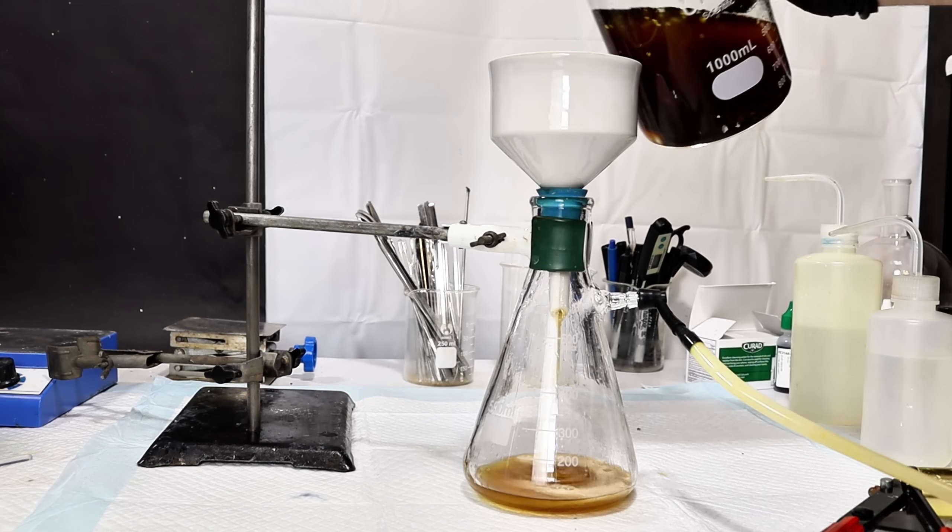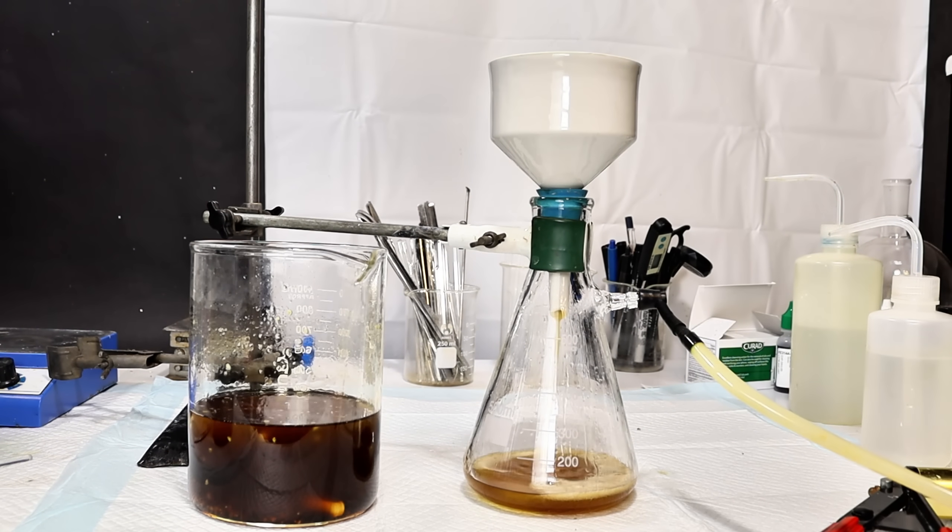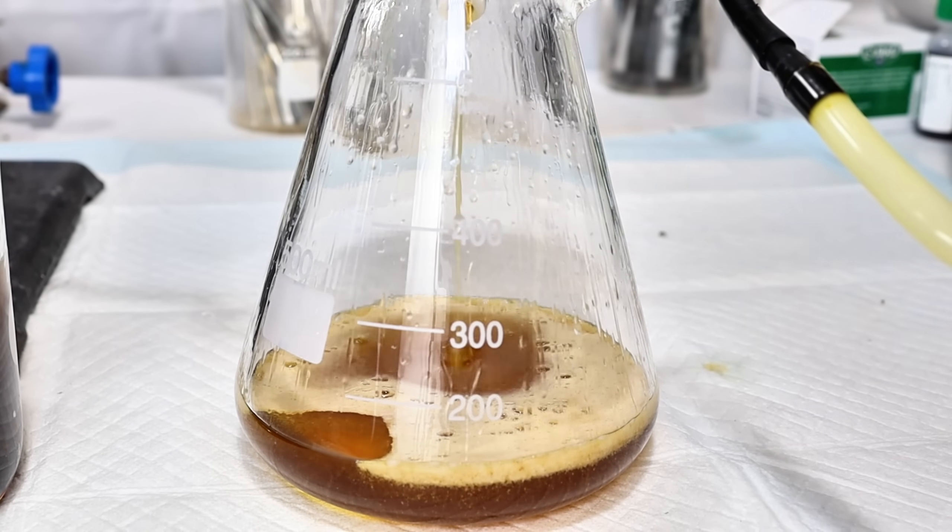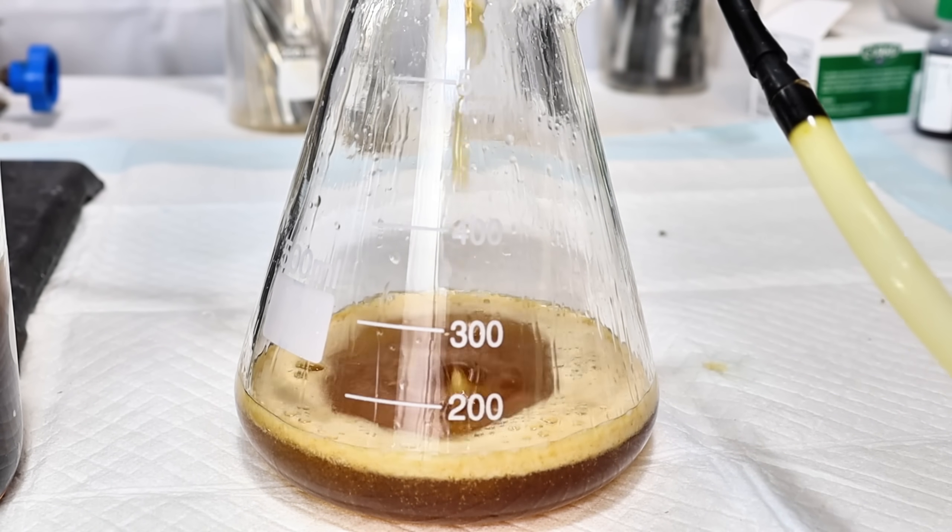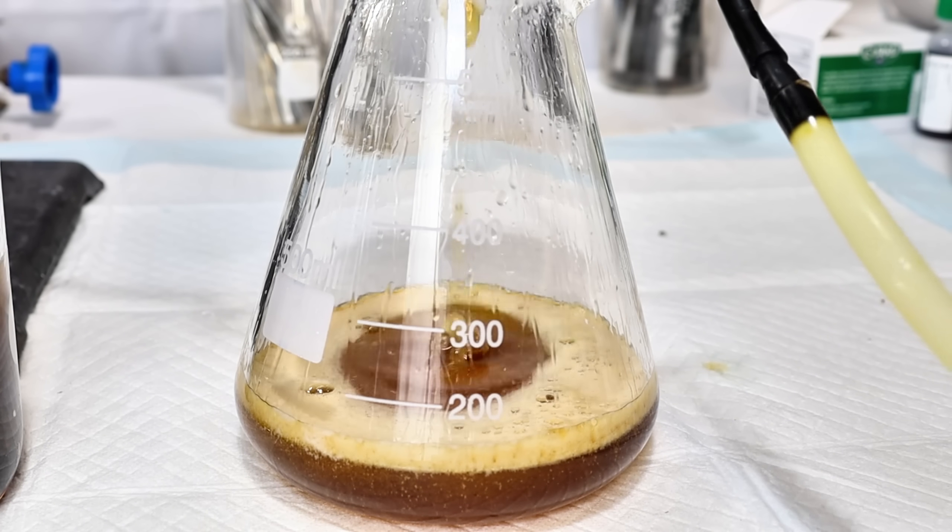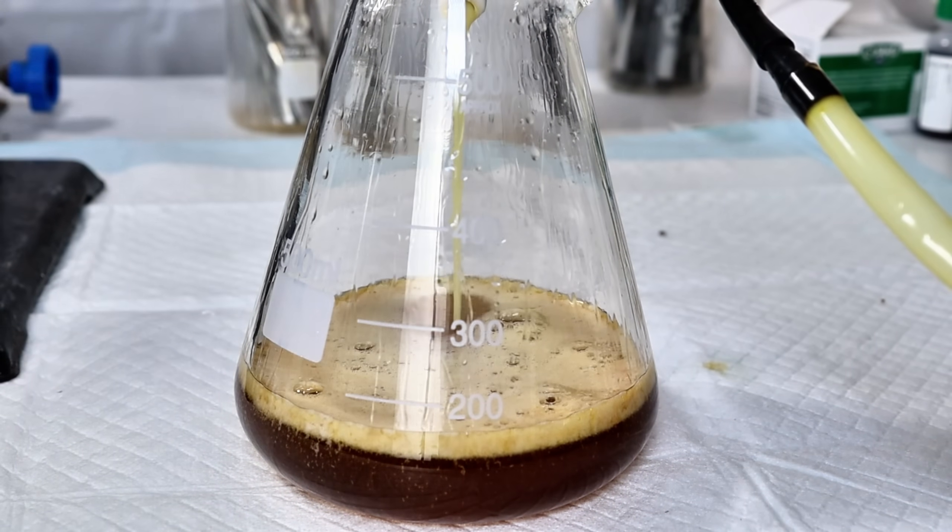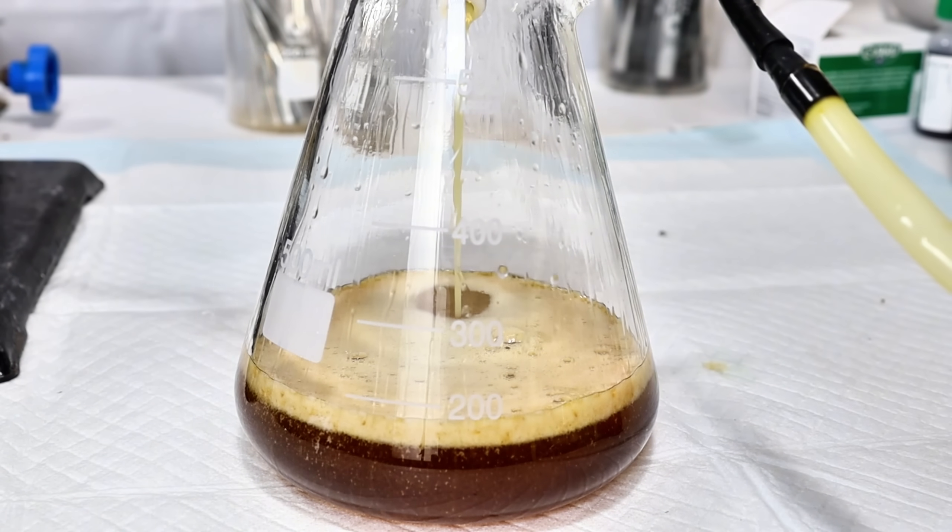As the reaction proceeds, the mixture becomes increasingly dark and eventually clears up. A lot of little bubbles are produced early on, which I suspect is due to unreacted methanol trying to evaporate. After about 30 minutes of reacting, I felt nothing more was happening.